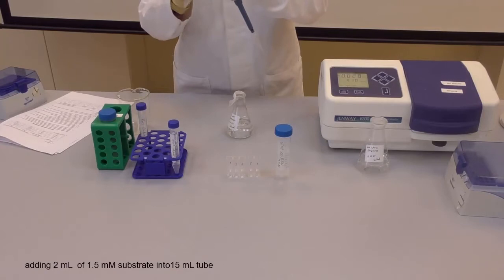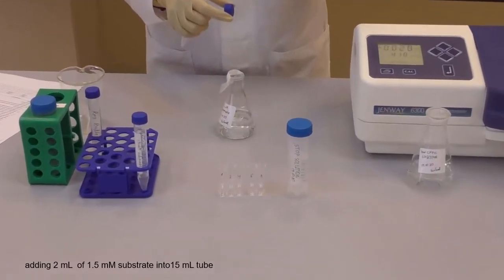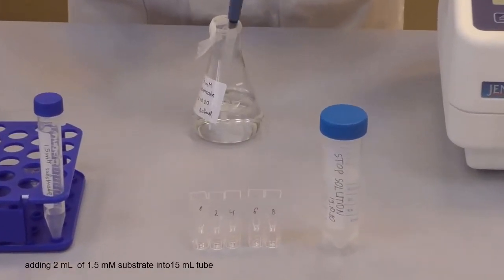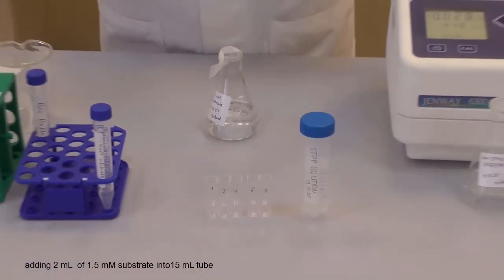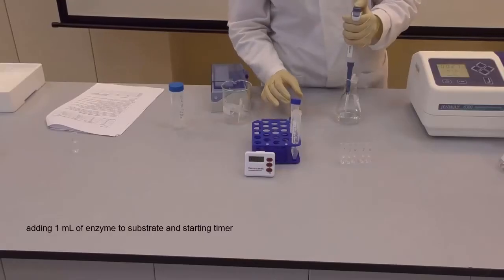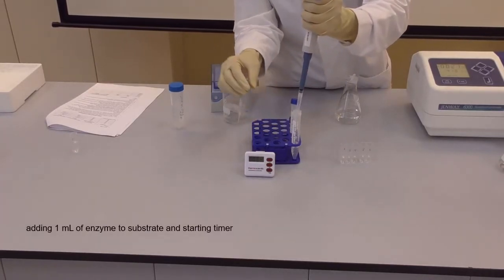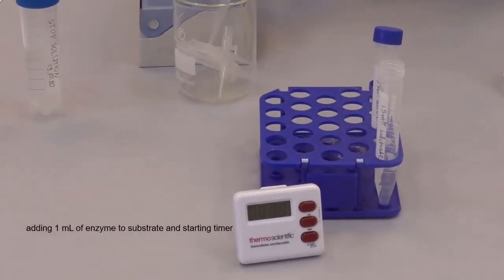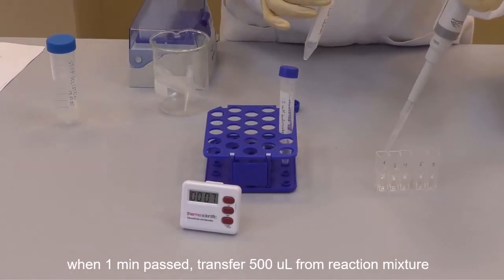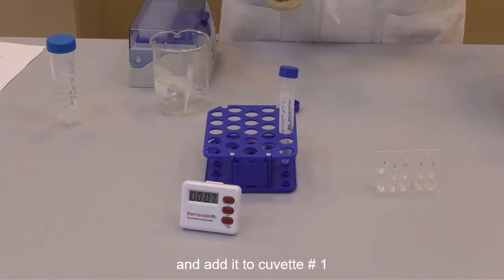Now we are adding 2 ml of 1.5 millimolar substrate into a 15 ml Falcon tube, followed by addition of 1 ml of enzyme. We set up the timer. When 1 minute has passed, transfer 500 microliters from the reaction mixture into cuvette number 1.